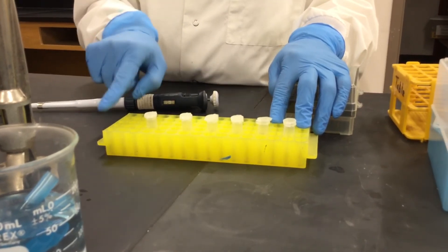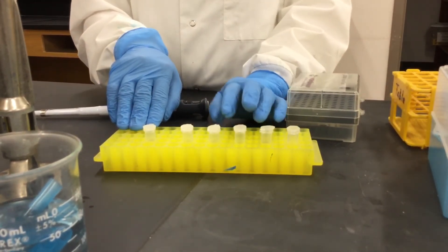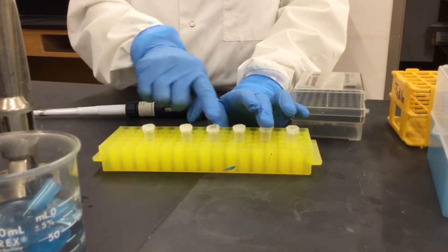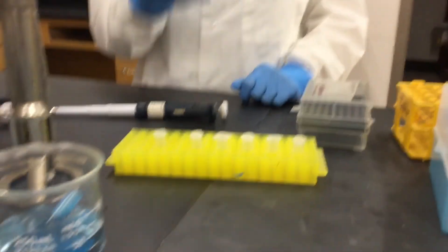And the ones that are going to be plated are the 10 to the minus 5, 10 to the minus 6, 10 to the minus 7, these three last ones. And this is all for this video, bye bye.